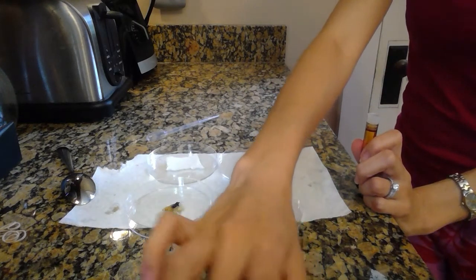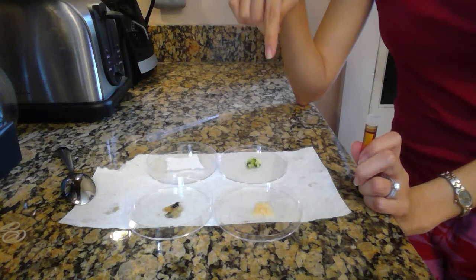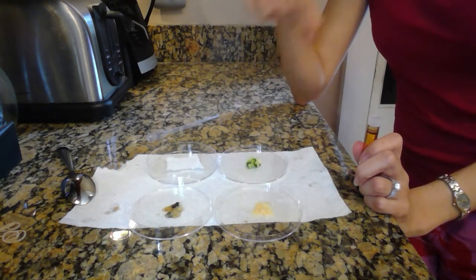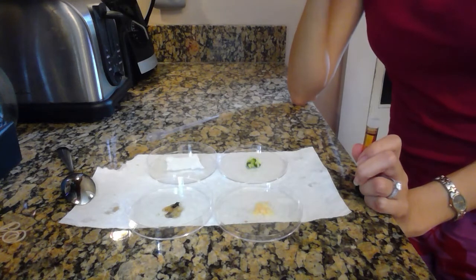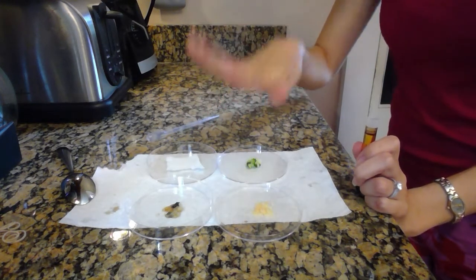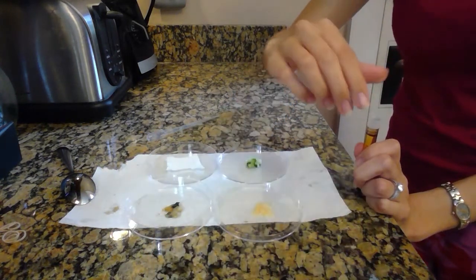So you're going to be filling out that table, and you're going to be looking at time 0, time 2, and time 4. So time 0 is right when you put that first drop on it. 2 minutes later, you want to note again what it looks like, and 4 minutes, you want to note what it looks like. So if that's a little bit too much to do with all 4, just do 1 at a time, and that's perfectly fine.